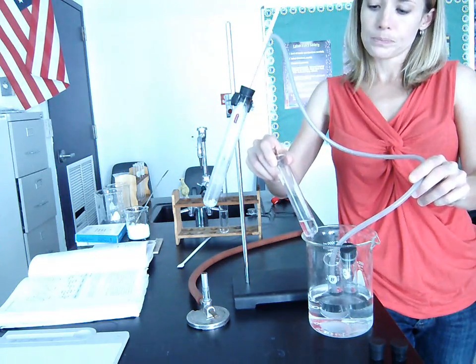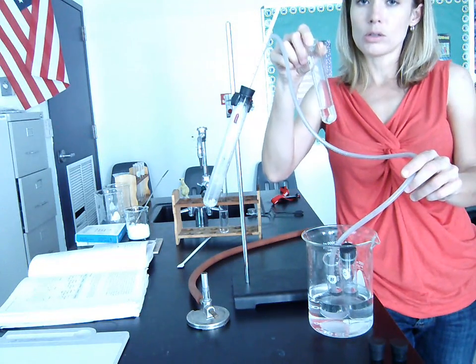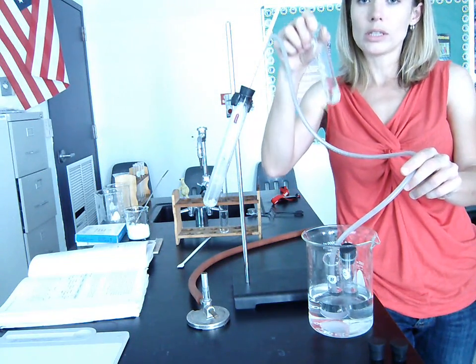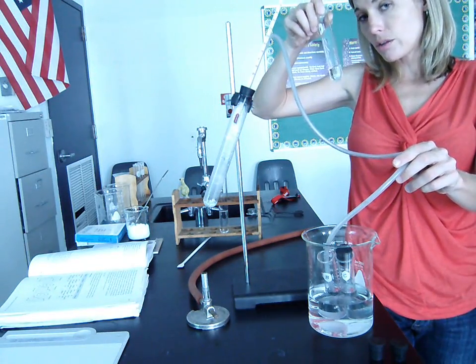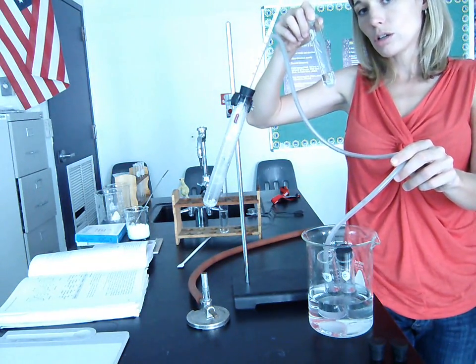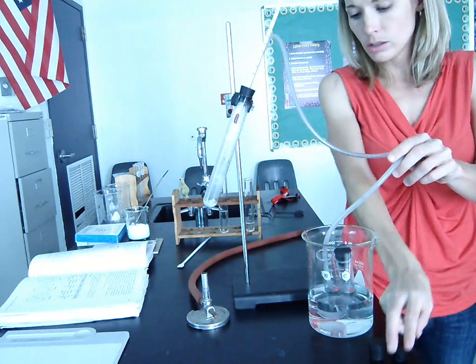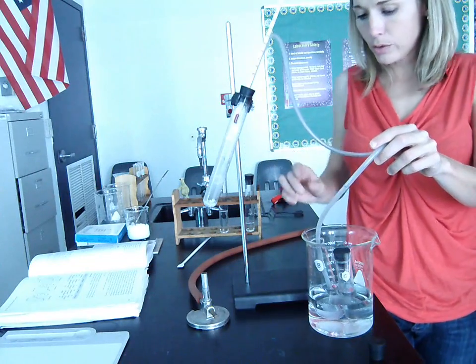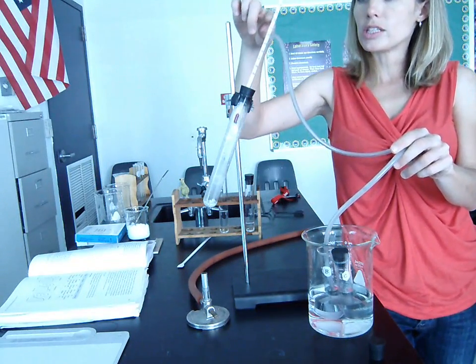So now we have test tube A, which contains all of the substance whose boiling point is 80 degrees. So this is part of our mixture that we've separated now. We've separated the part of the mixture whose boiling point is 80 degrees. We can put that over here and put a stop. Okay.